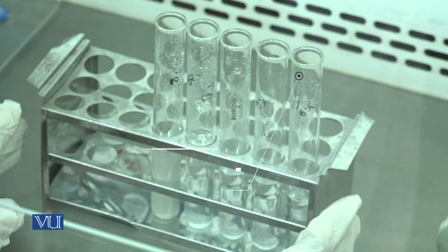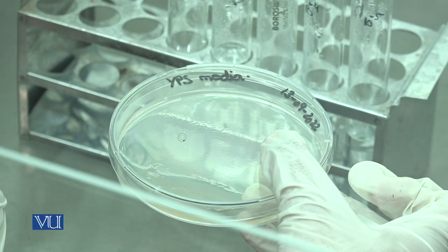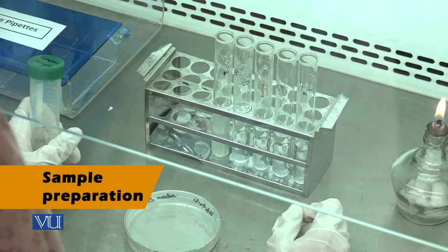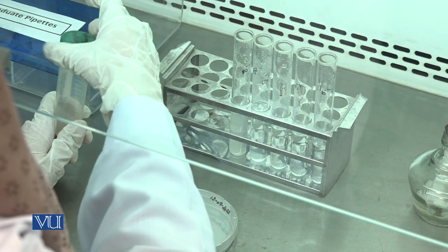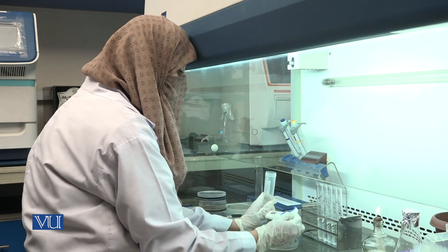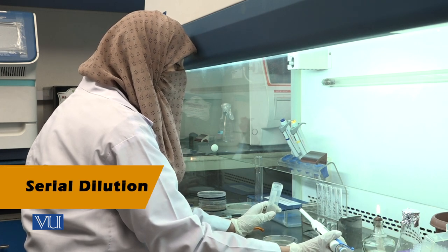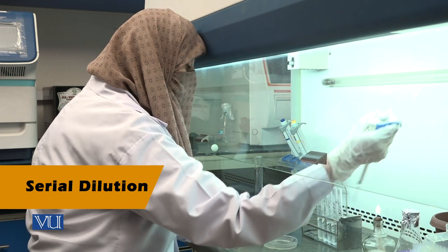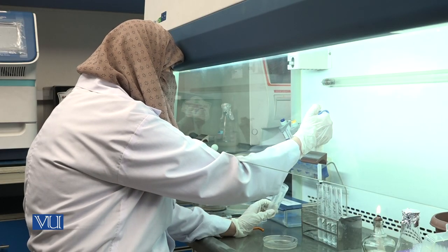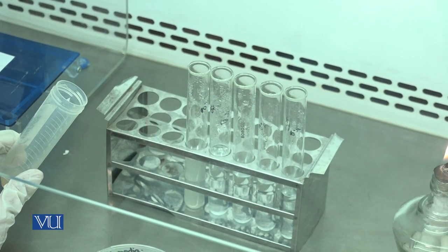For the isolation of yeast from a fermented product, the following procedure is used. Test tubes containing 9 ml sterile distilled water are prepared. Take 1 ml into the first test tube; in a similar way, 5 dilutions are made.